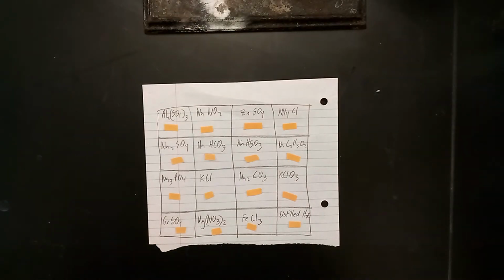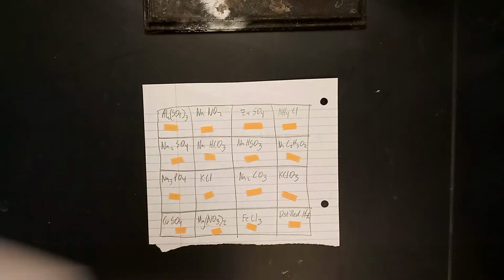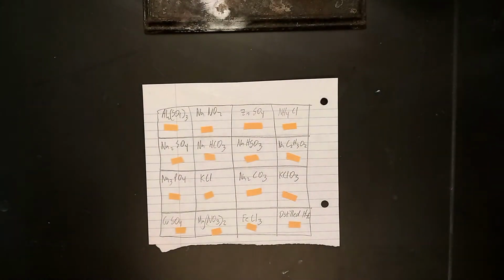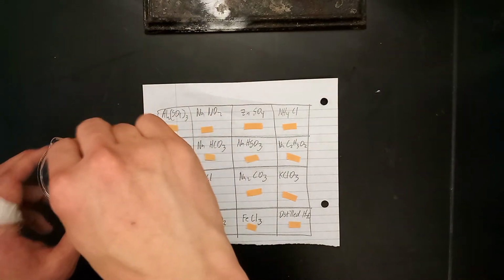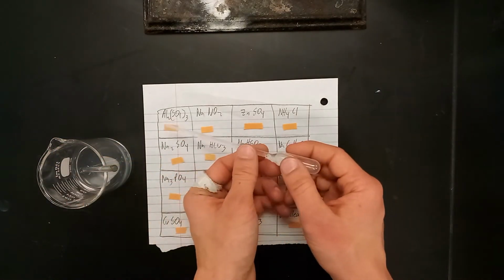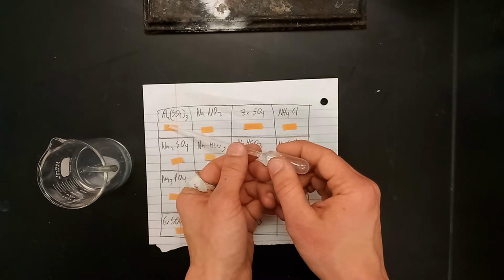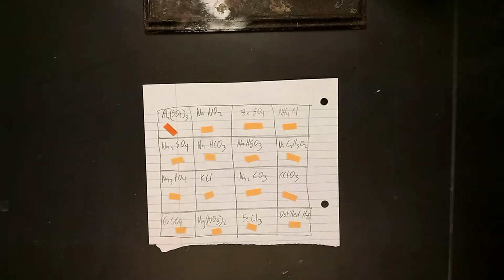And now we have the strips of the pH paper on each one of those 16 different squares. The 16 different squares are arranged like they are arranged on the lab itself. So these 16 squares correspond to those 16 squares. And now I'll start to do this. So starting in the top left corner, here's the aluminum sulfate. So we just want to get a drop or two onto the pH paper itself, like so that it's wet, and move on to the next one.